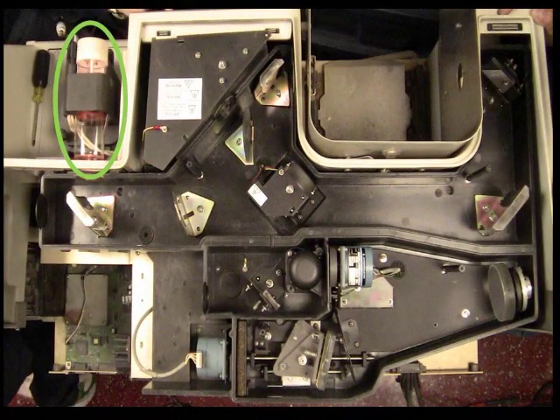The entire process begins with the source. The source, circled in green, is what emits radiation or light. The most common source for AAS is a hollow cathode lamp, which can be read about in full detail on another page. The source emits radiation, which is then directed by a mirror to the chopper.